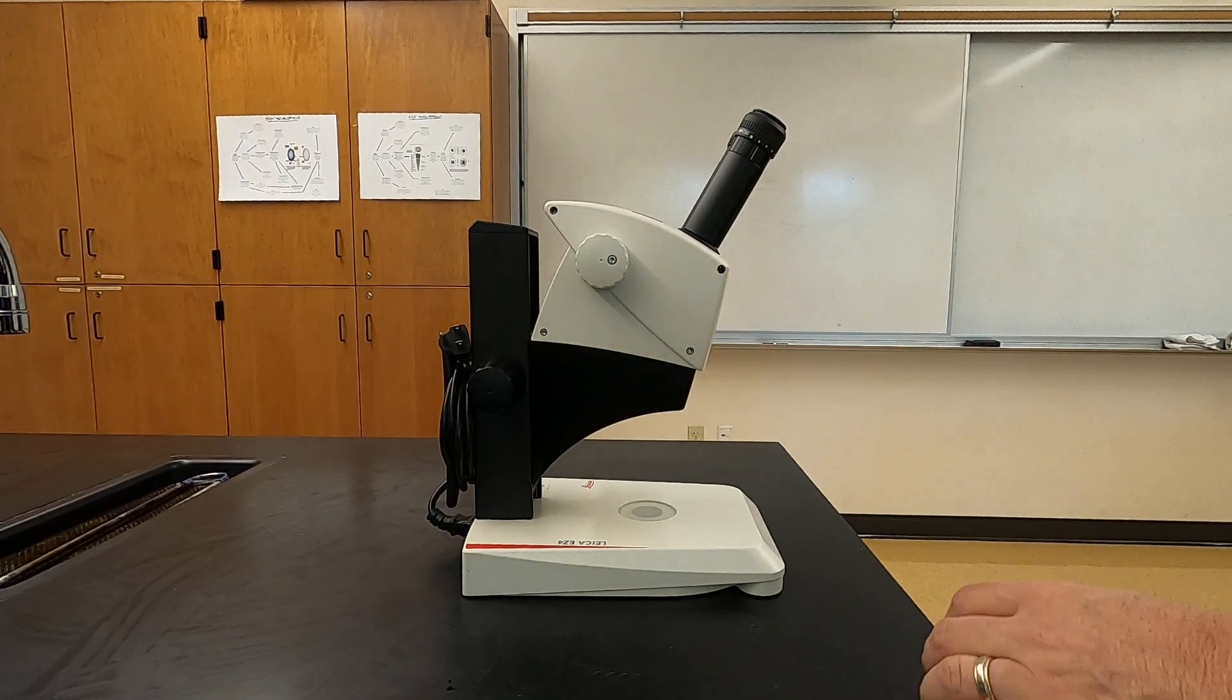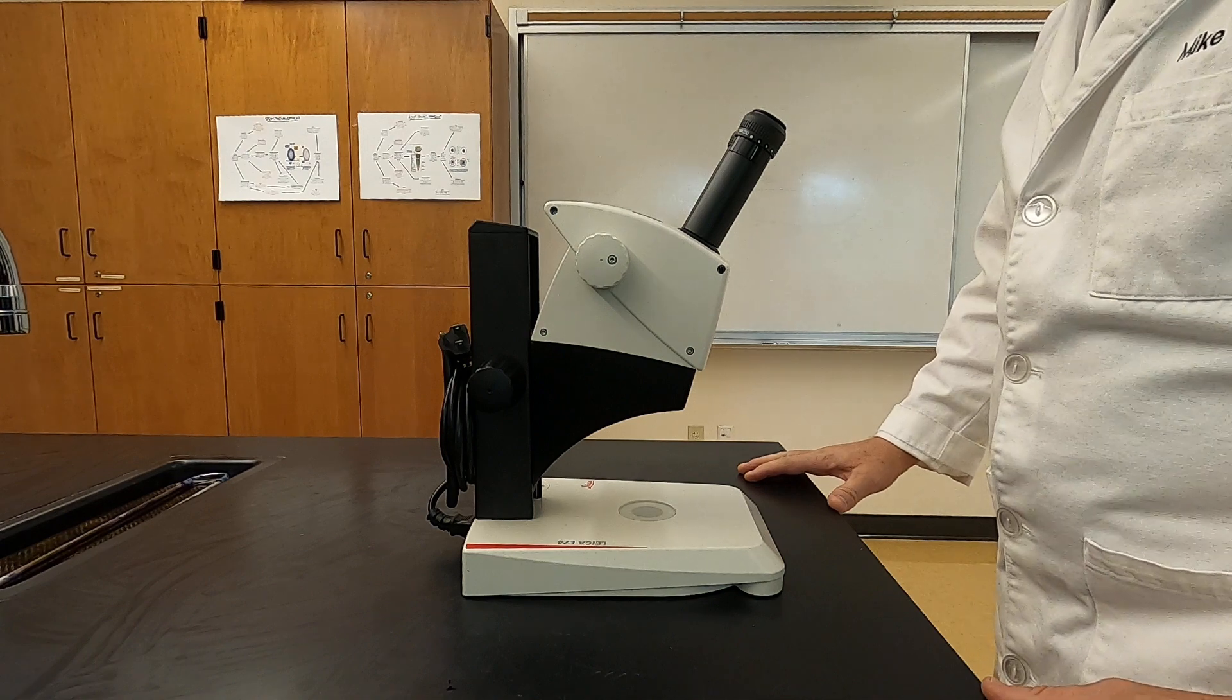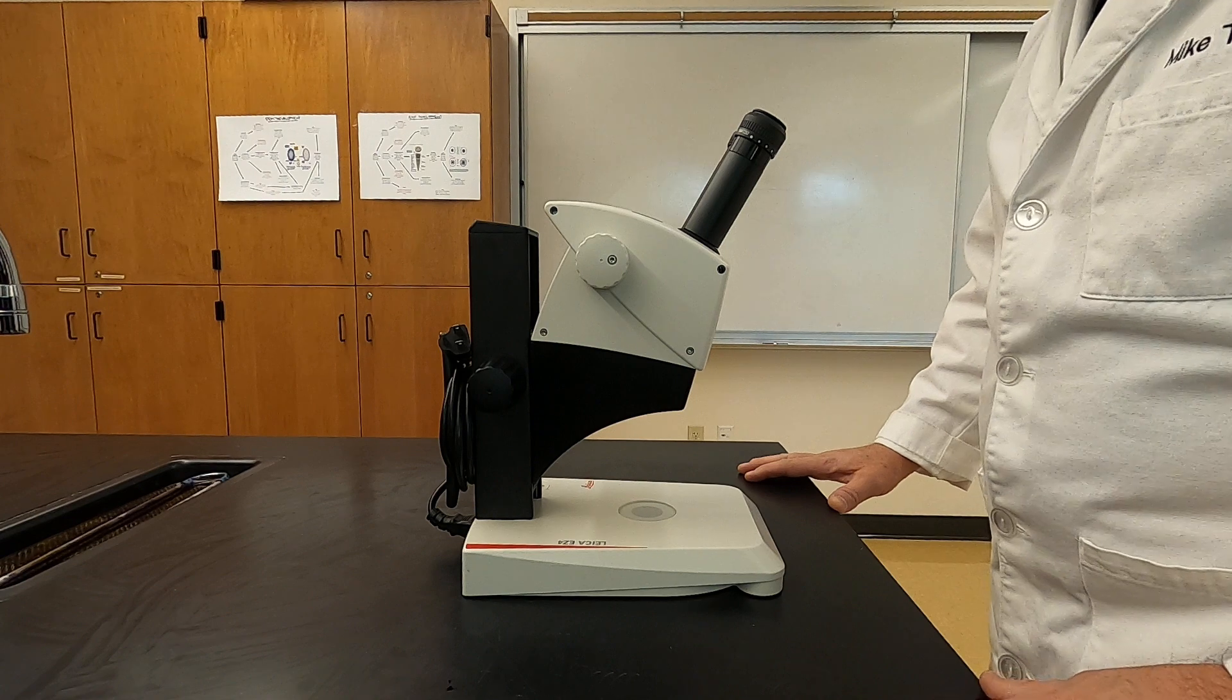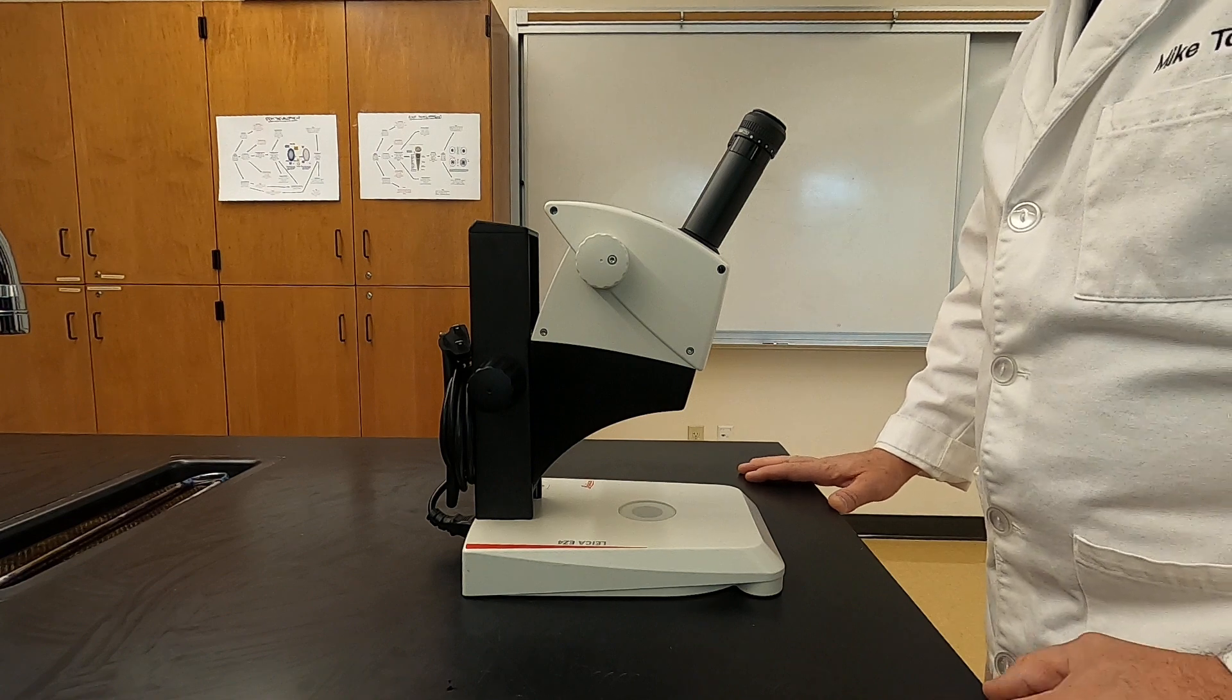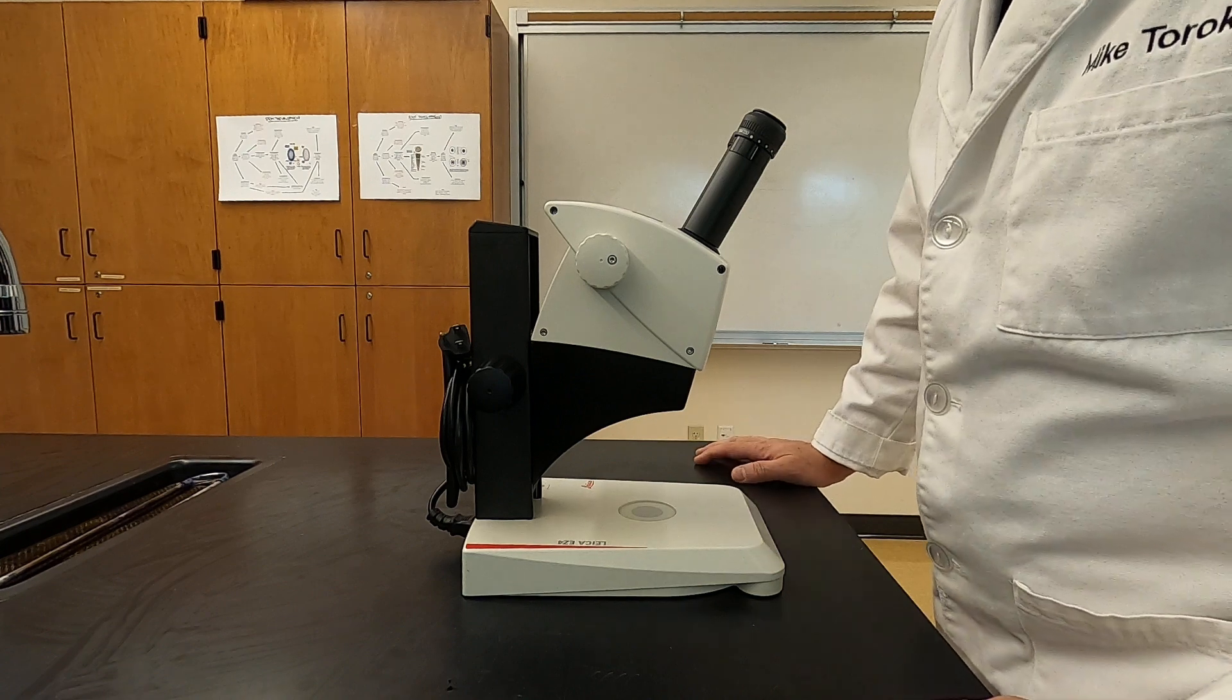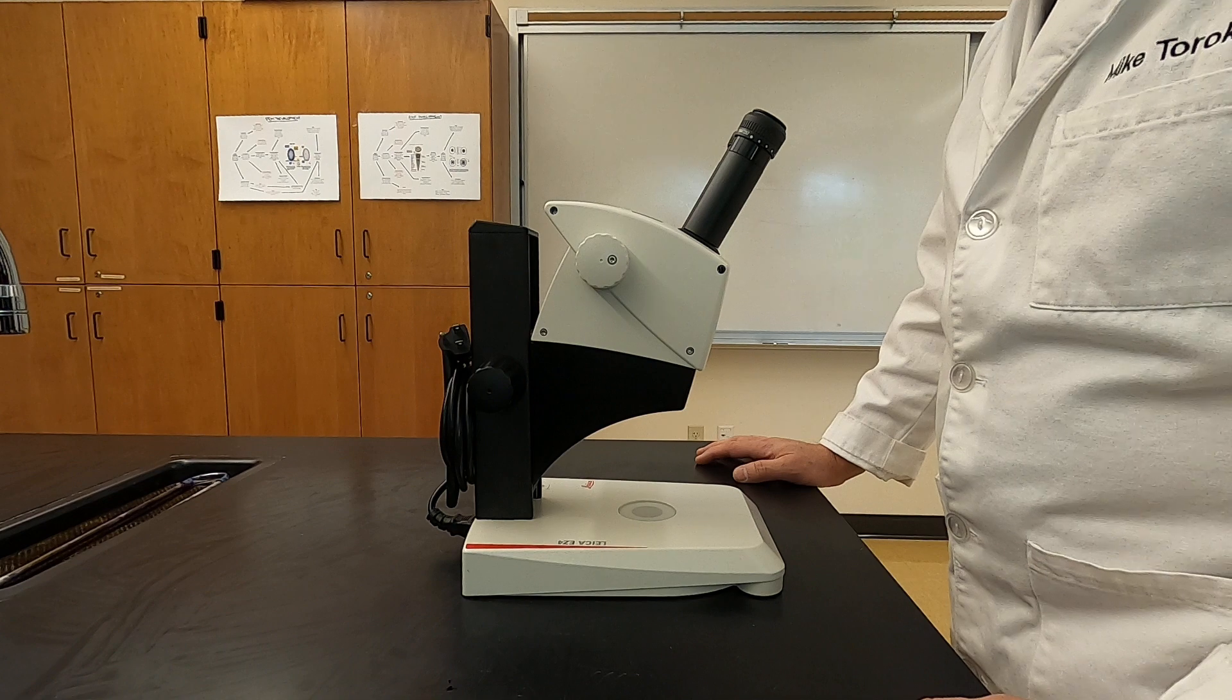This is the other type of microscope that we will be using occasionally in lab this semester. Not very often, but a few labs will call for it. This is a dissecting microscope made by Leica, and dissecting microscopes have similar components to what we would see in compounds, but they're much simpler.